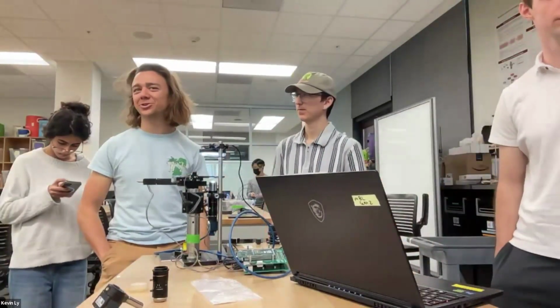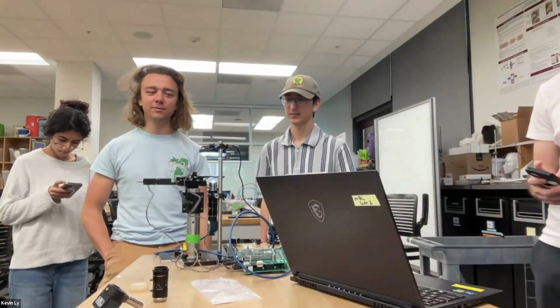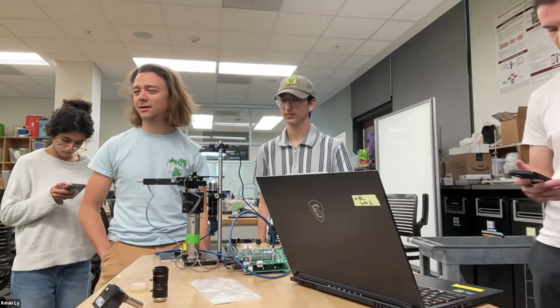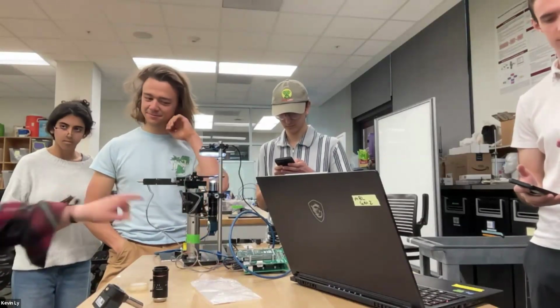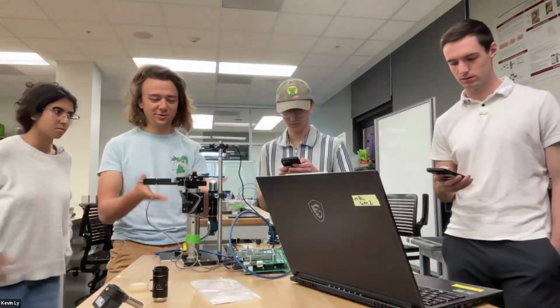For 3D stuff, sometimes imaging is from below, but the light is from above, so it needs to be translucent enough. So some method to try different samples. You would need something that shines from below, which is something that's so cool.